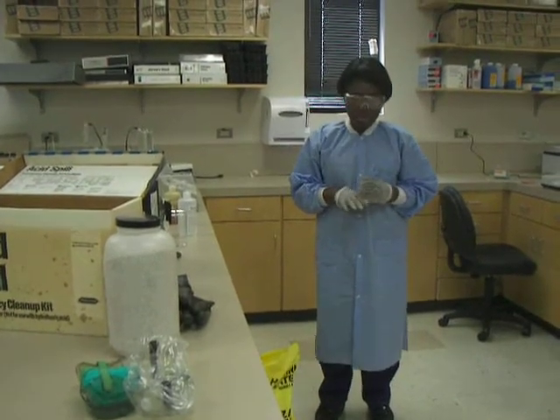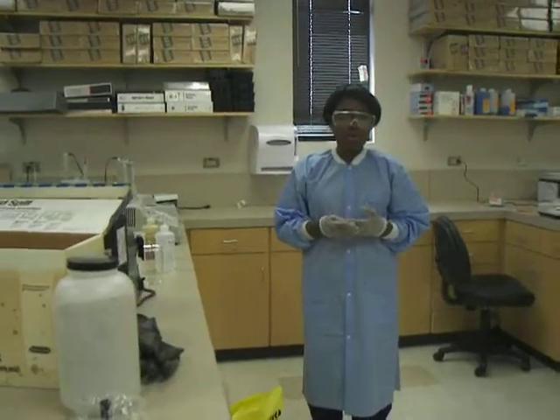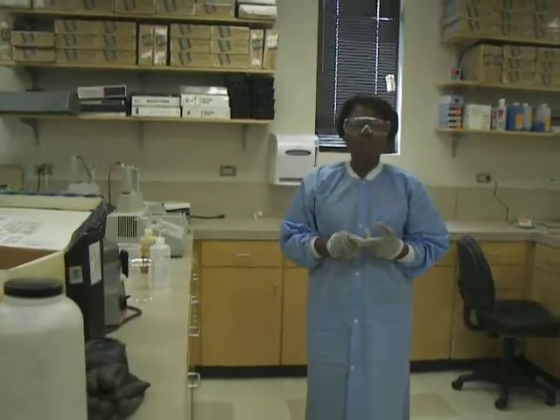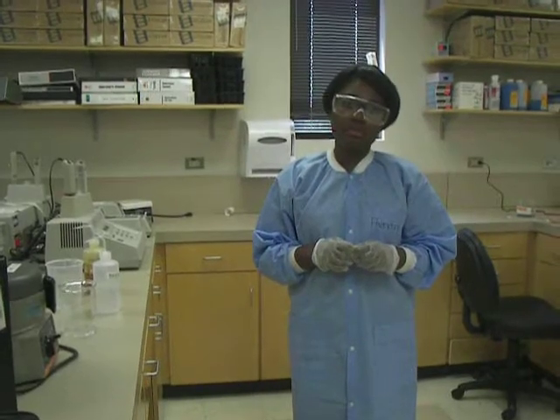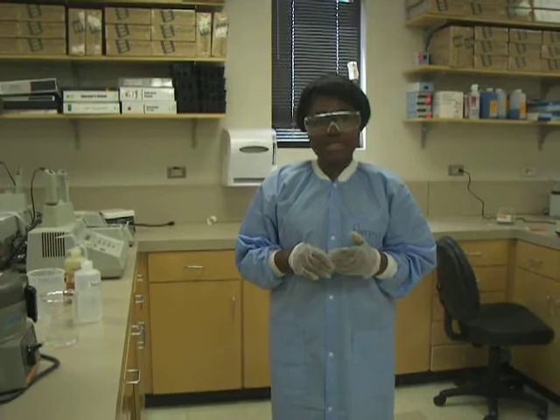Remember, any kind of spill — whether it is large or small — always notify the lab supervisor. If it is a serious one, please call the emergency phone. Work safely when you are in the lab, and always remember that every chemical in the laboratory is presumed hazardous.